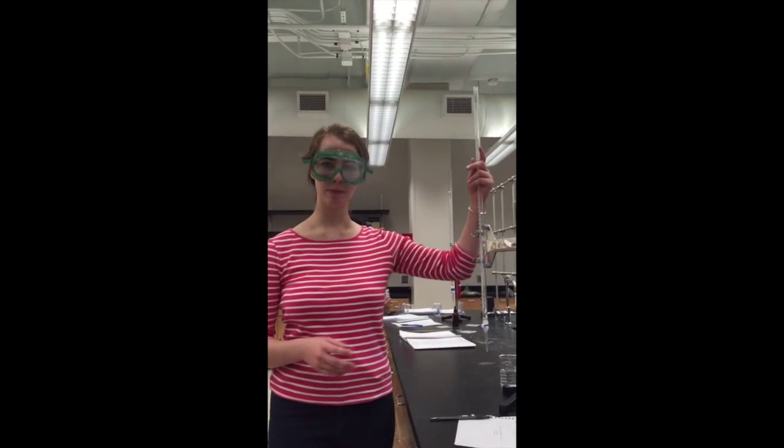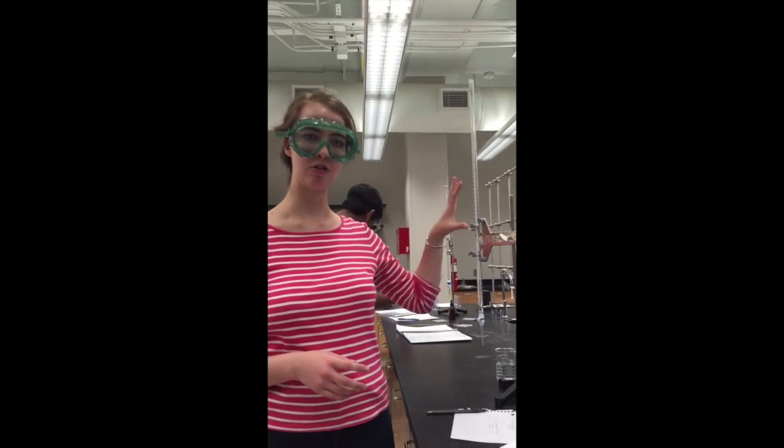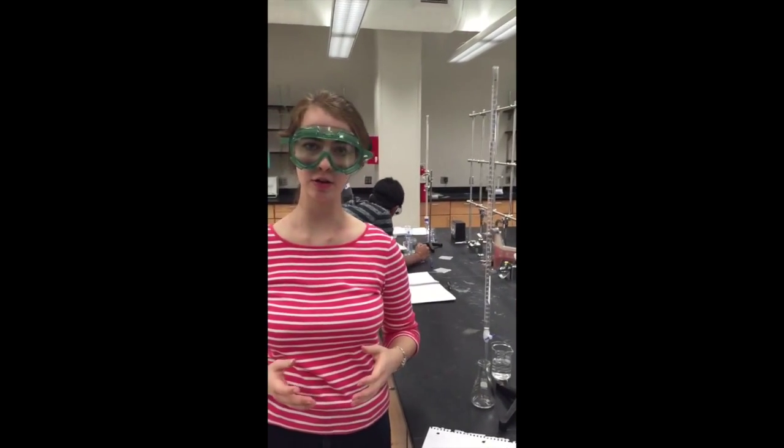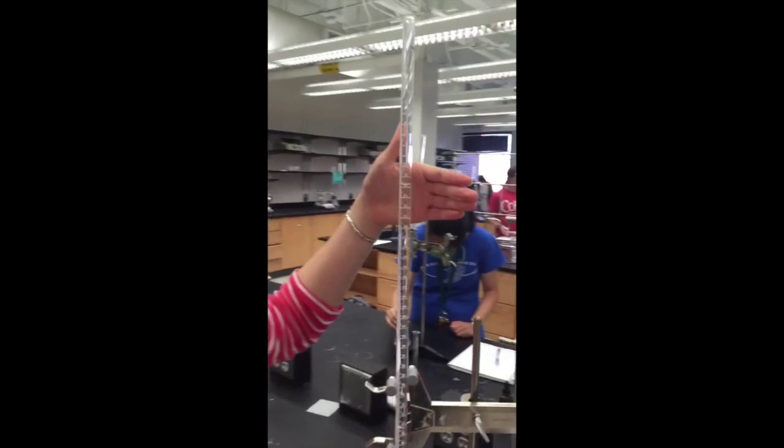And after the titration, what you need to determine is the final volume in your burette. The final volume will help you determine the volume delivered of the solution in the burette. Using that, you'll be able to determine the molarity or concentration of your analyte solution. For the volume delivered, the first thing you need to do before you begin titrating is to determine the initial volume of what you have in the burette.